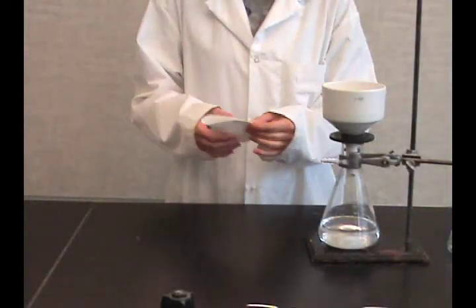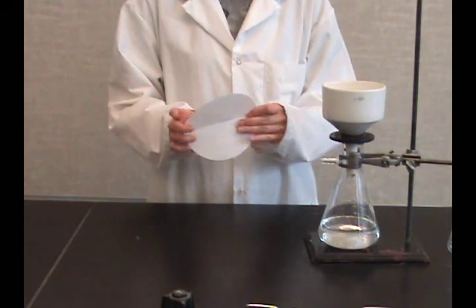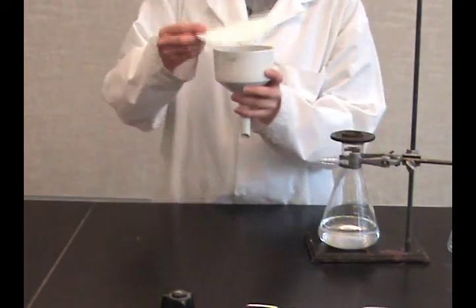Acquire a filter paper larger than the one in the funnel. Fold it in half. The crease helps with transfer to the receiving vessel.